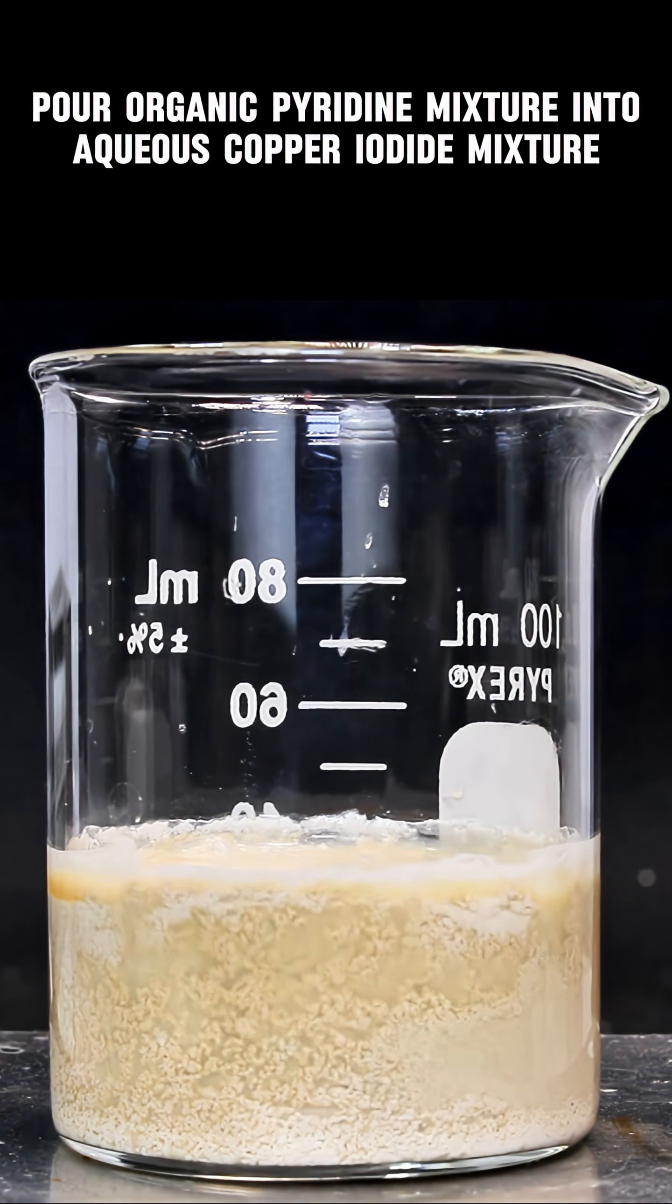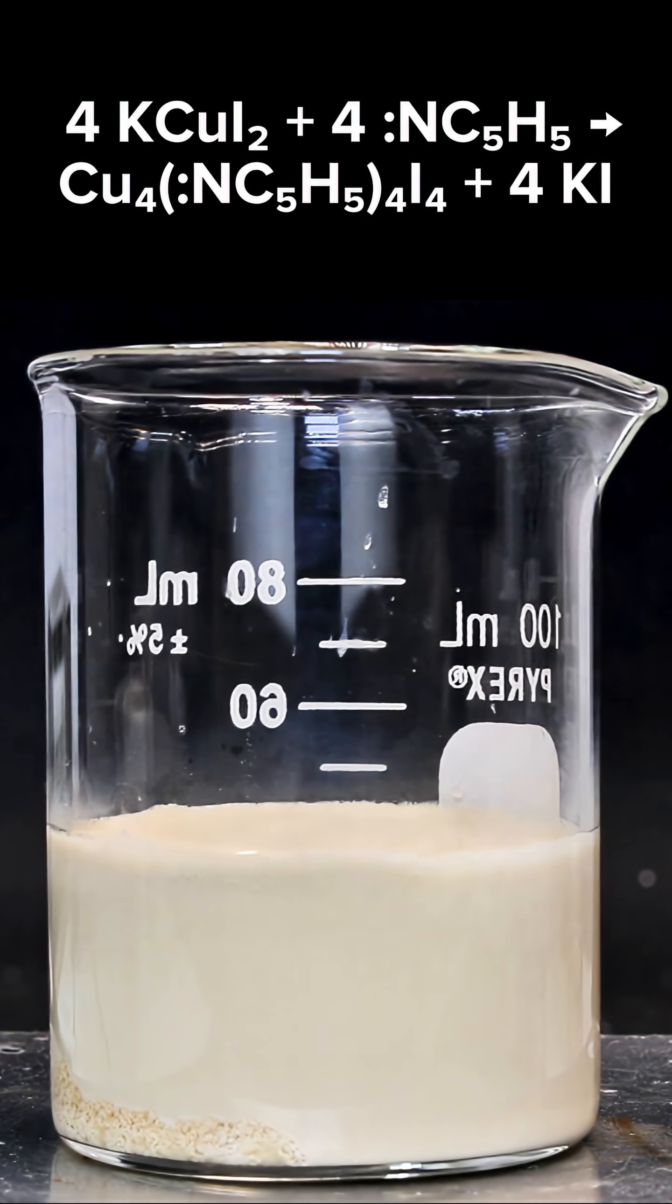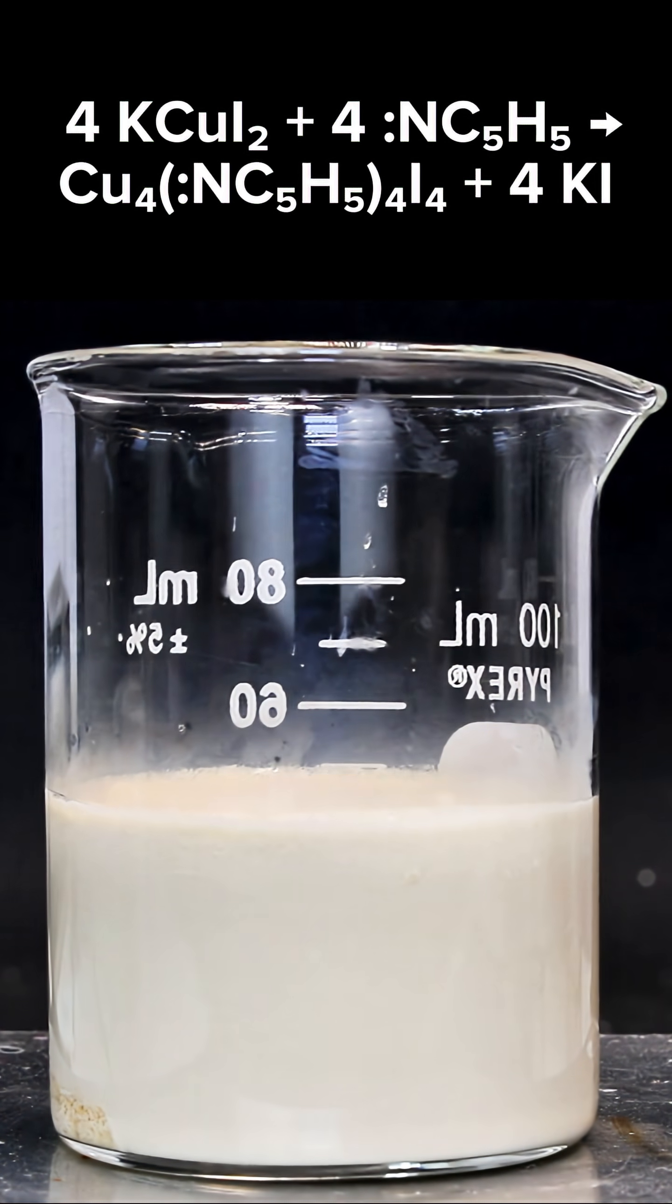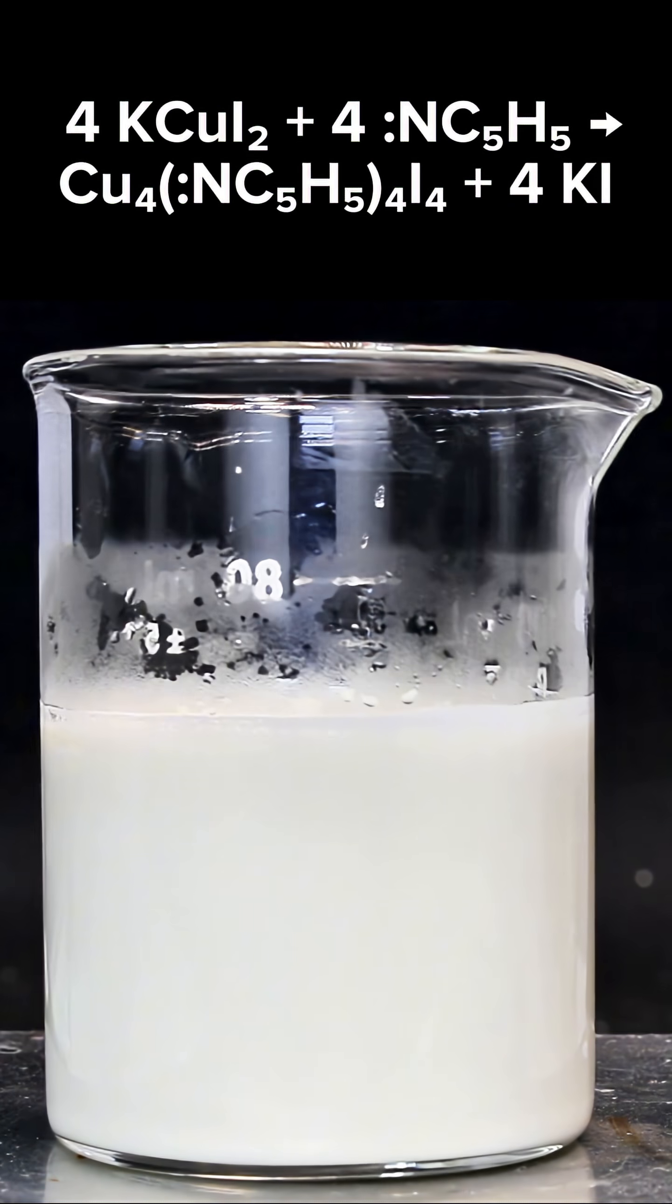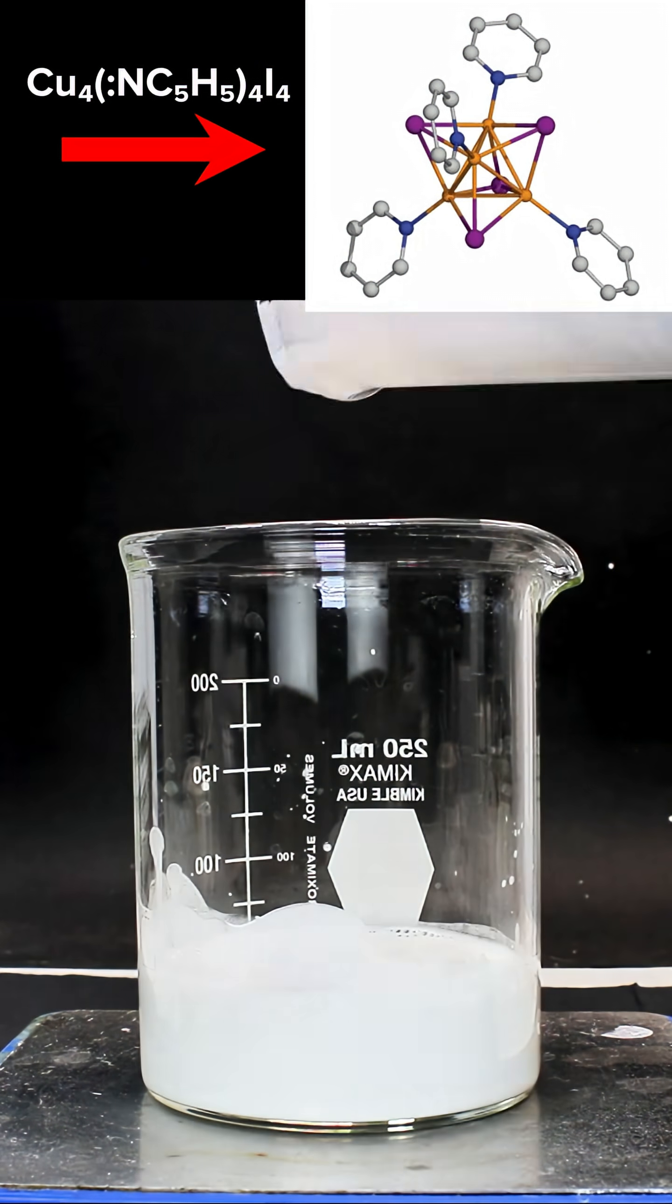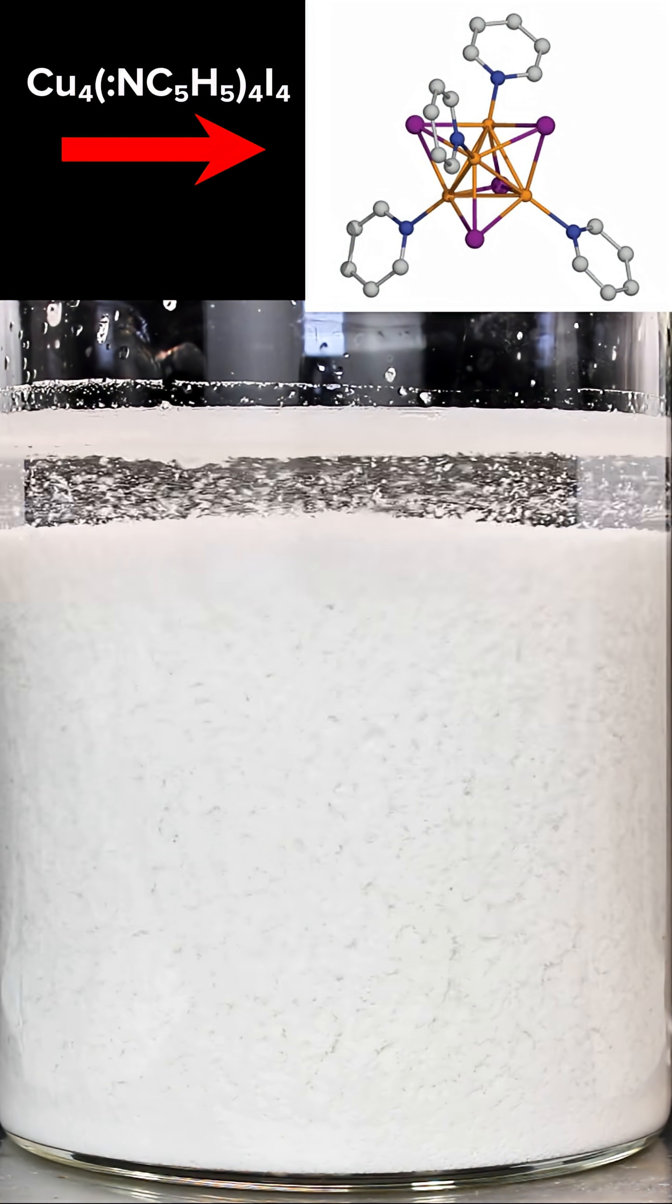As a quick safety note, be careful when handling pyridine because it's toxic and smells terrible. Our product here is a fascinating metal-organic complex between copper, pyridine, and iodine. I honestly don't know what this chemical would be called, but it has a fascinating geometry where all the pyridine molecules are pointing outward.